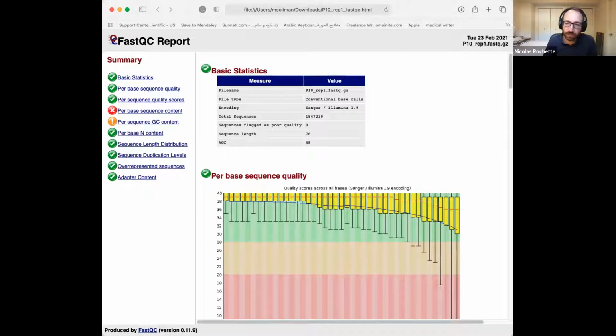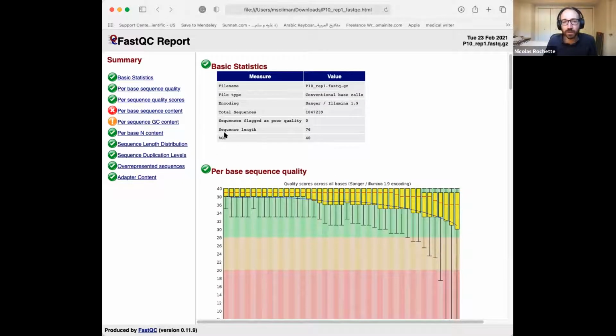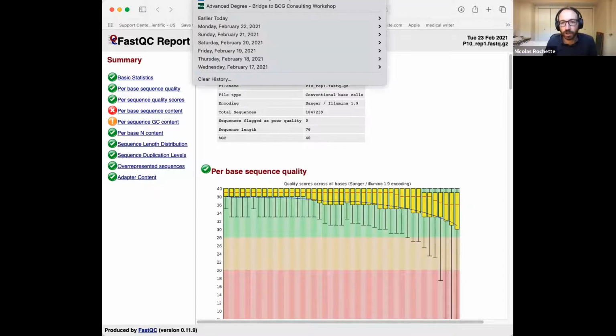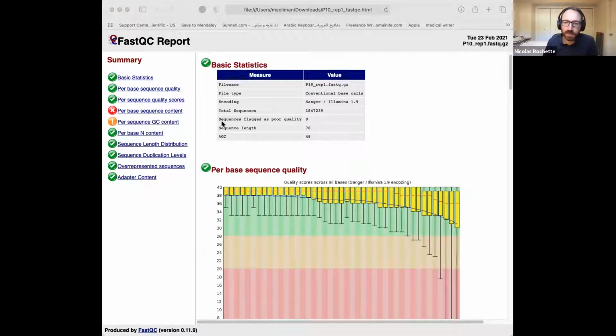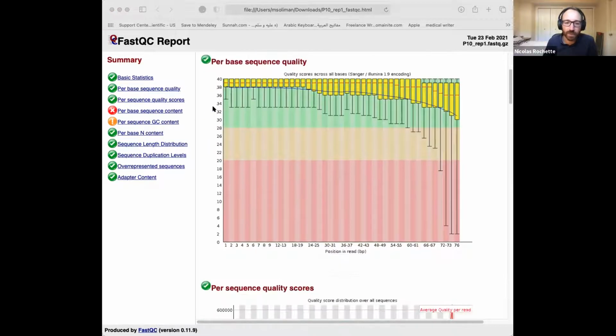And what we can see is that there's a slight drop, and this is a good run, especially with modern Illumina instruments. They've become very reliable, much more than 10 years ago, when people built the knowledge. I'm not sure how old FastQC is, but a lot of these tools were built around 10 years ago. And so we do still see a drop in quality from base 1 to base 76, from the beginning to the end of the read.